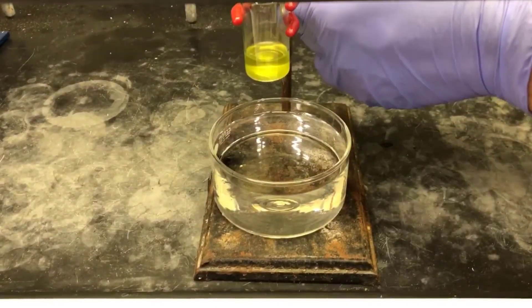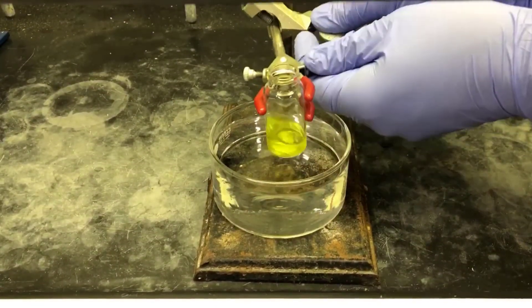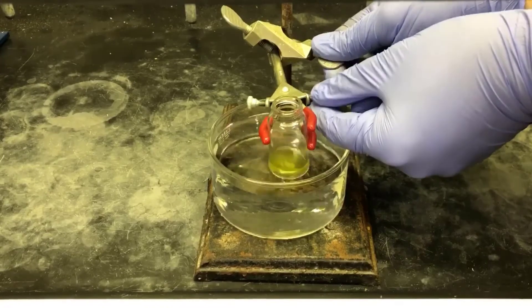To speed the process up, I'm lowering the vial into a warm water bath. This is water from the tap, but it's not very hot.